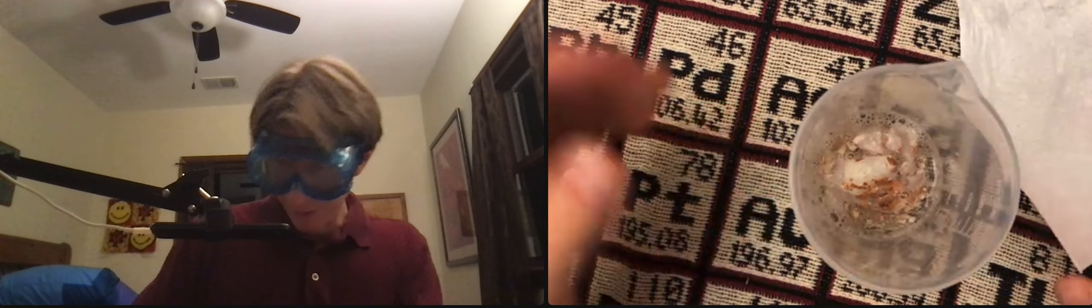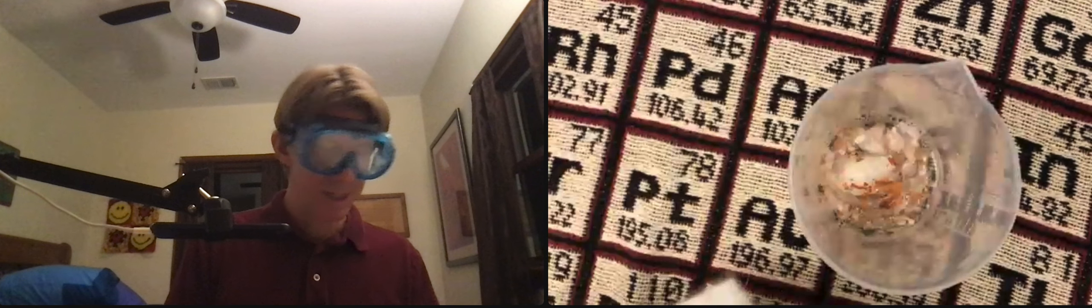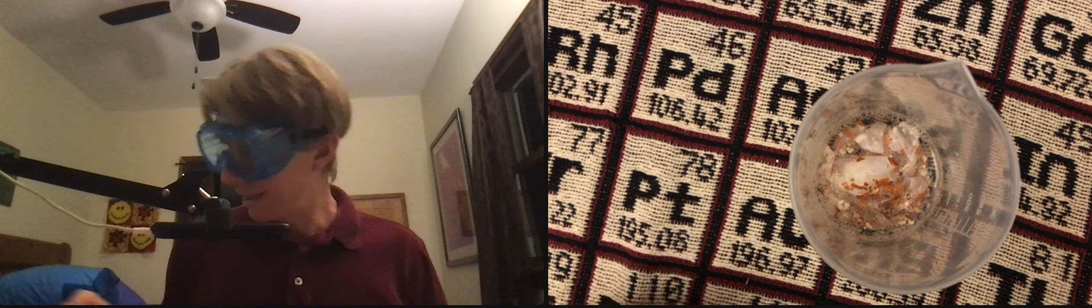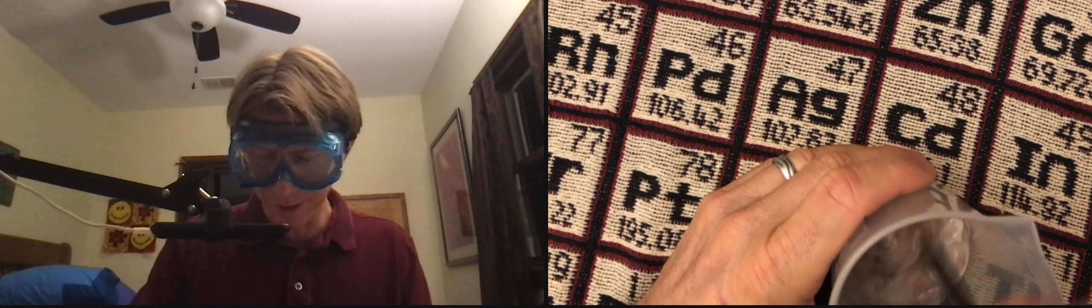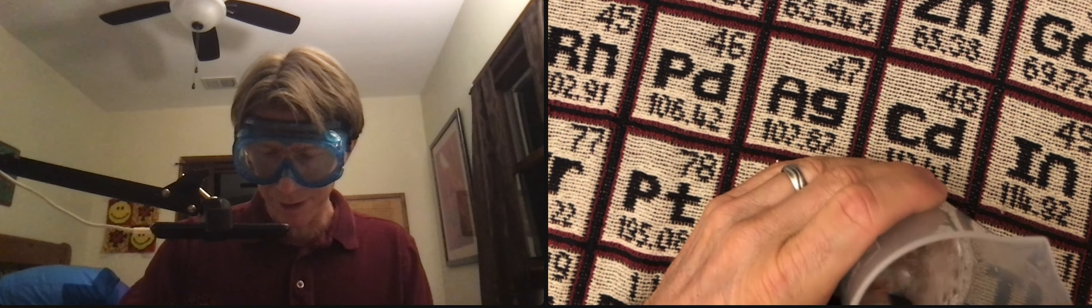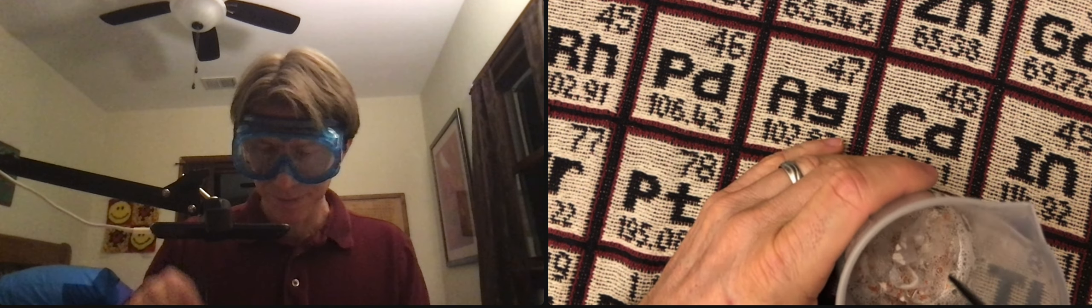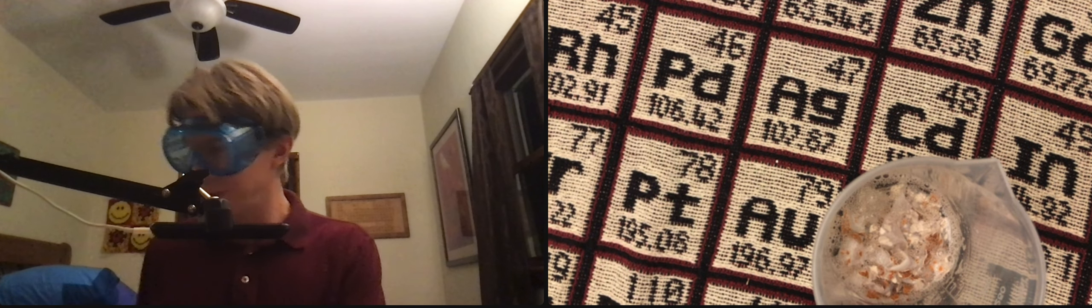Here's my paper towel - it looks pretty good, a couple tiny pieces in there. I got my spoon. The membrane's filling up there. I'm going to start squishing it. You know what, I think I did this wrong. I don't want to use the back end of my spoon for this one, I want to use the spoon end.